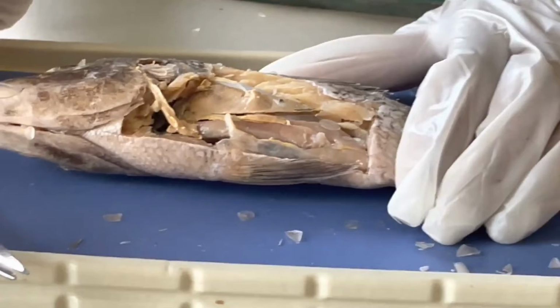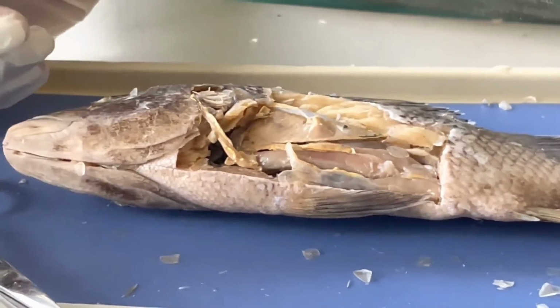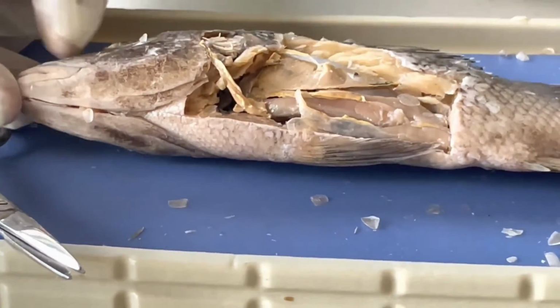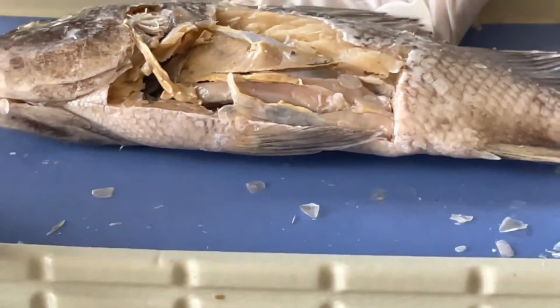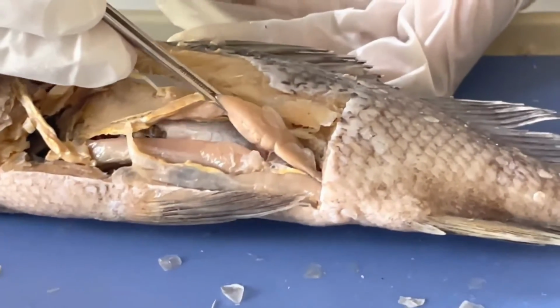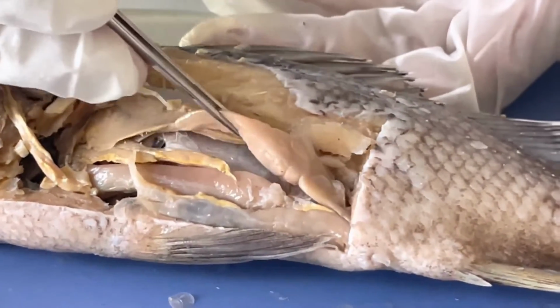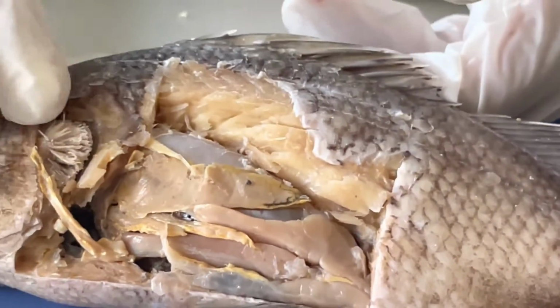You can tell if a fish is male or female by looking at its reproductive organs. A female will have a large ovary that is made of eggs, and a male will have testes, which come in a pair. So over here, this fish would be a male. Here's the testes of the fish. There should be one more, but it is underneath one of the organs. So here's the testes of the fish. Therefore, this is a male perch.